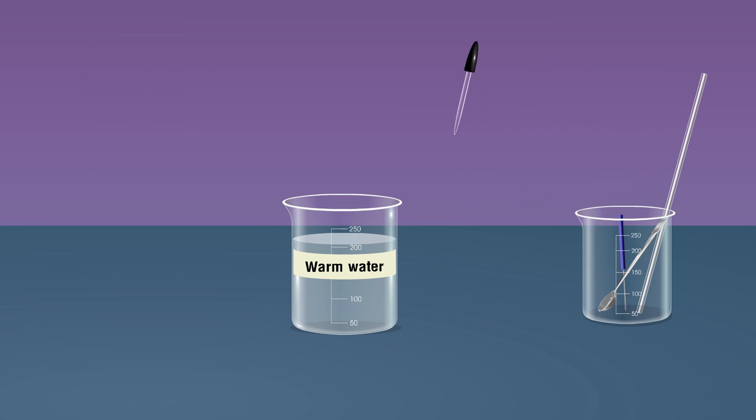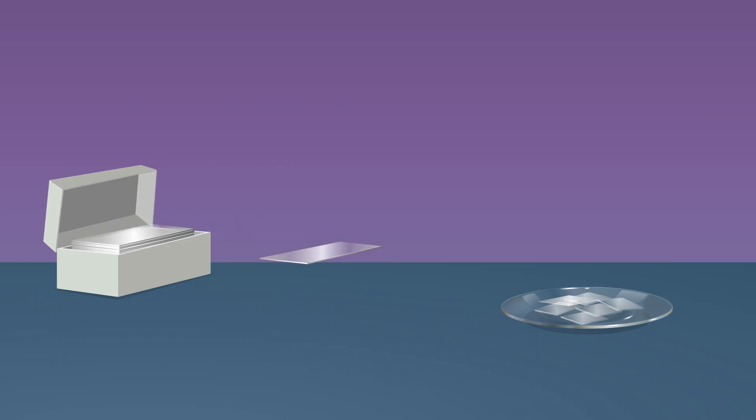Using a dropper, take a drop of the solution from the beaker and place it on a glass slide.